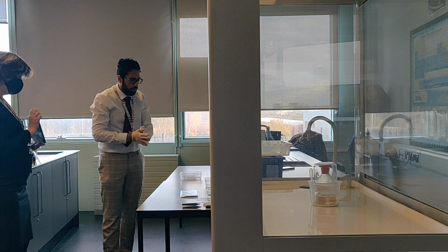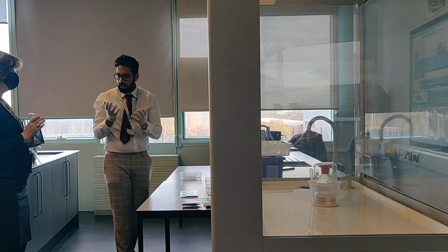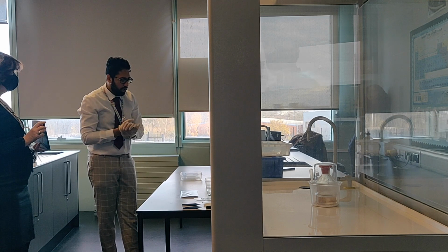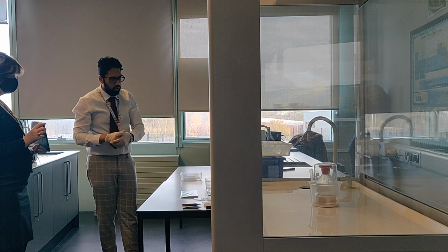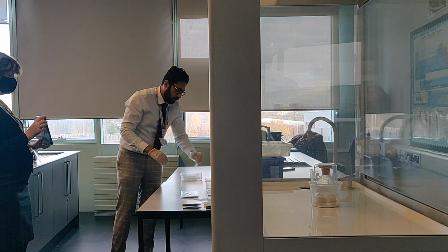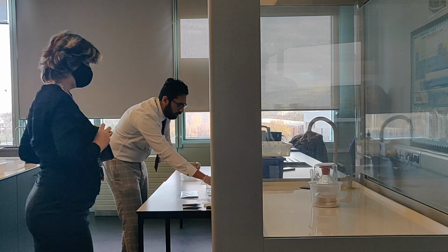Right, okay guys, final test. This one I need to wear gloves, because I'm using straight sulfuric acid. This one tests for halide ions in solid salts, using concentrated sulfuric acid. So the test tube, we're going to put some potassium chloride.